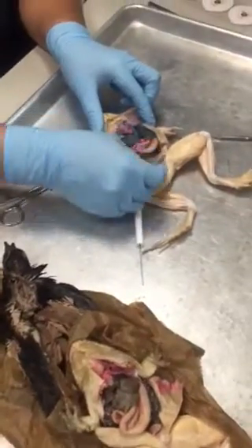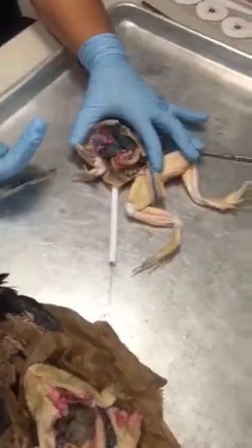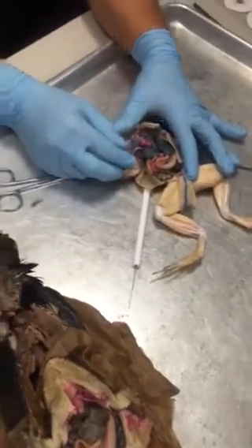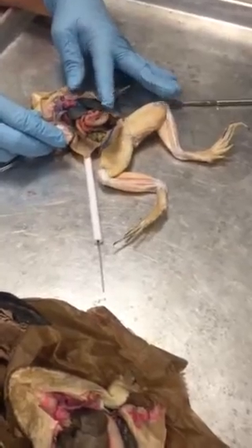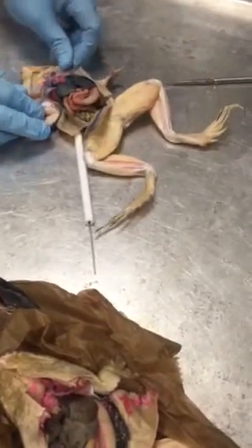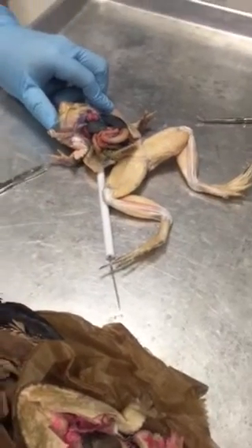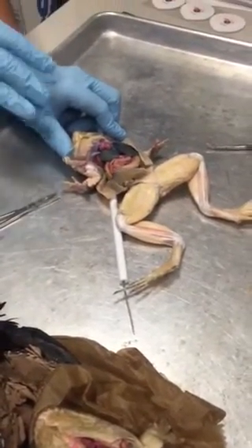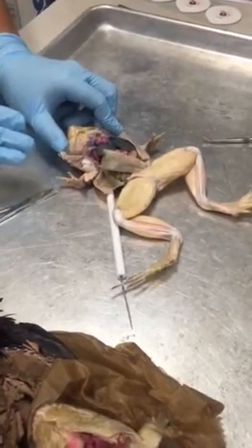pericardium, but you also may have noticed that there's this big, huge vein running up the central portion of the ventral side, and that's called the ventral abdominal vein. Right, so the heart itself has 3 chambers, and because it only has 3 chambers, that means there's oxygenated and deoxygenated blood that's mixing in the ventricle.